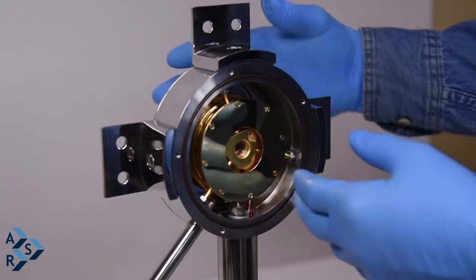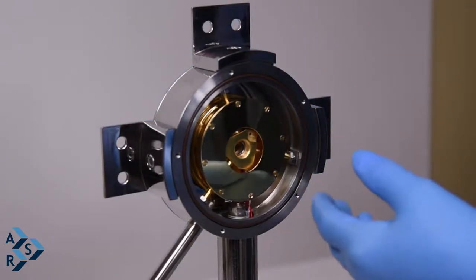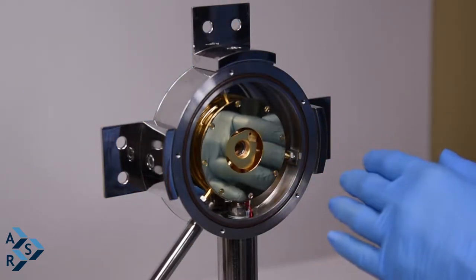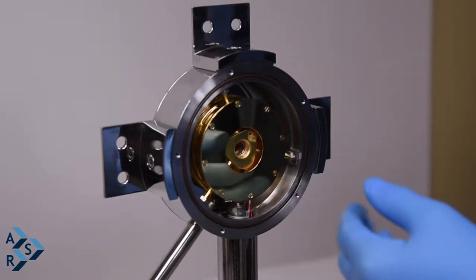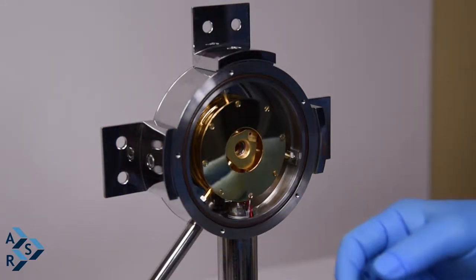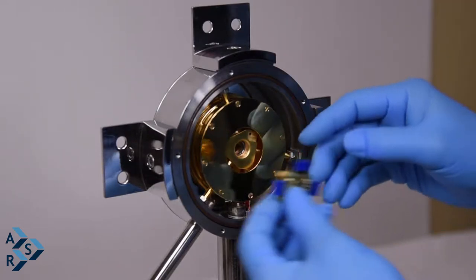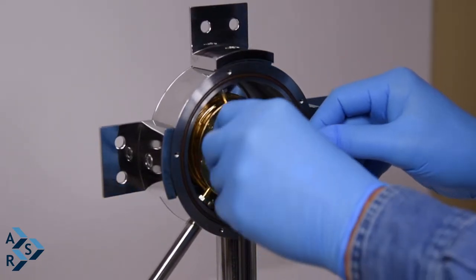If you do it this way, you don't have to take this part off. It takes a little longer to change your sample, but I recommend doing either one, whichever works best for you. So here's this particular sample holder, and then you can get this started.